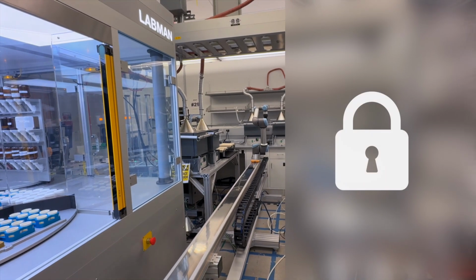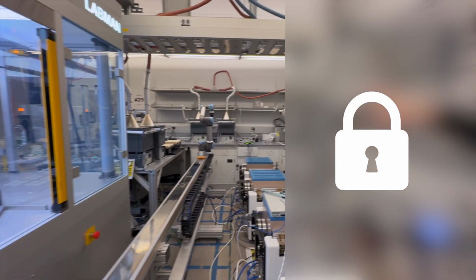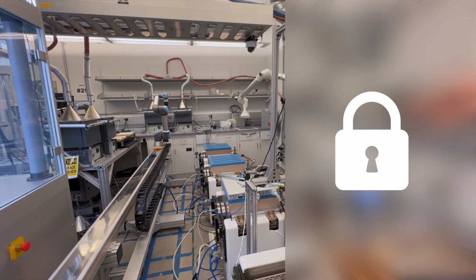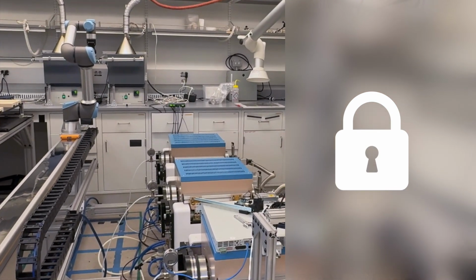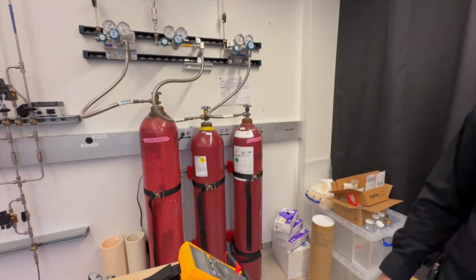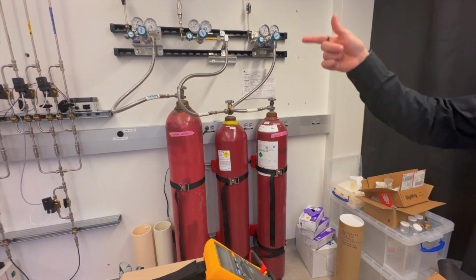We can do reactions in air here, and we can do reactions that are not in air on these furnaces that are on the floor. They are tube furnaces. So we can control the environment, the atmosphere, for example, by using argon, oxygen, or nitrogen. So from here, after the reaction is performed, we have to take the sample and then do the analysis. So now we go to the other side again to show you DASH, the powder recovery.